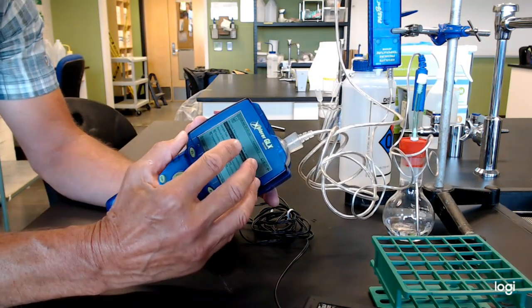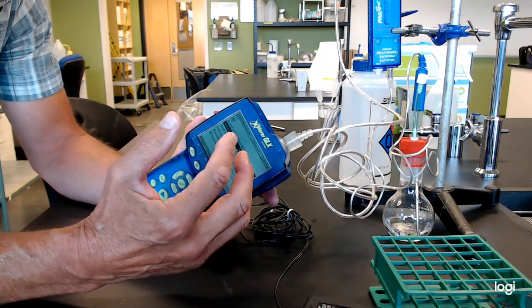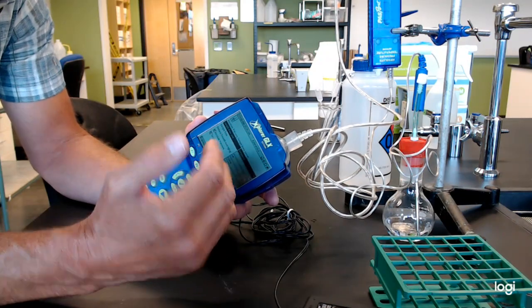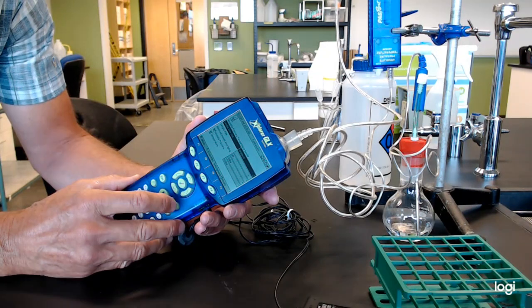But you'll see this later in the pH probe and some of that stuff. Anything you do with the sensor, anytime you're calibrating it, that's that bottom right-hand screen where you go to the sensor.